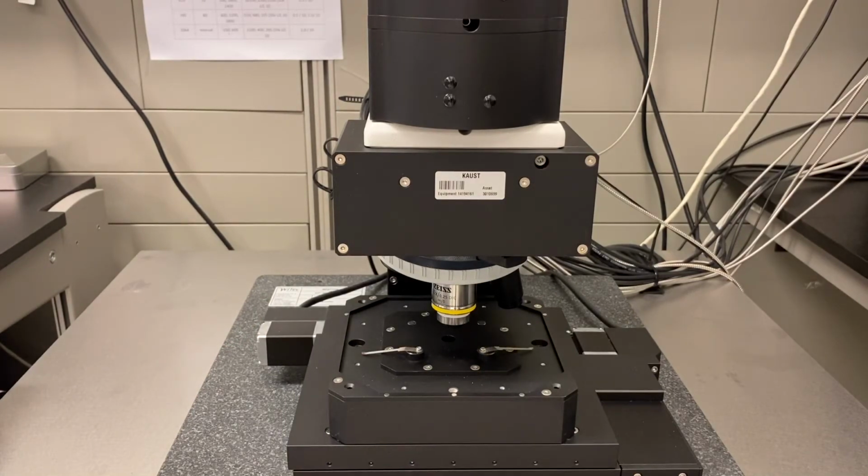Gently introduce the sample that is attached to the glass substrate. Do not apply force on the stage to fix the position of the glass. Use tweezers. No dirty fingers or gloves are allowed here.